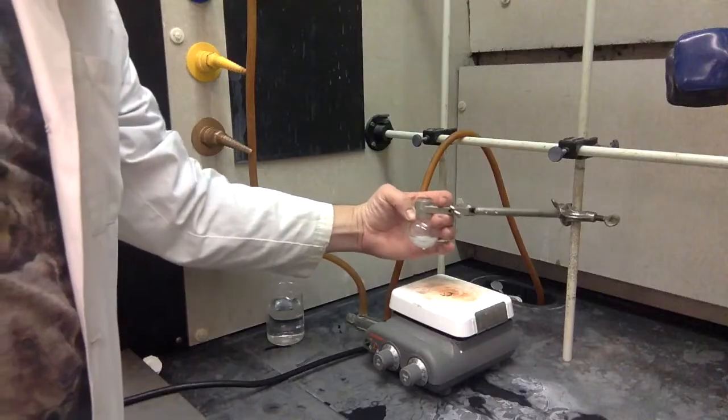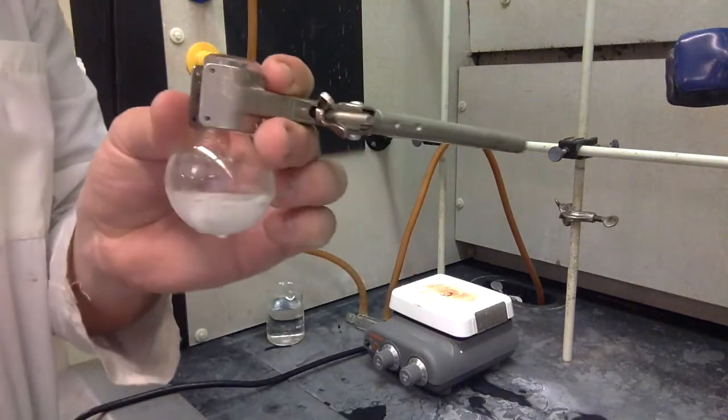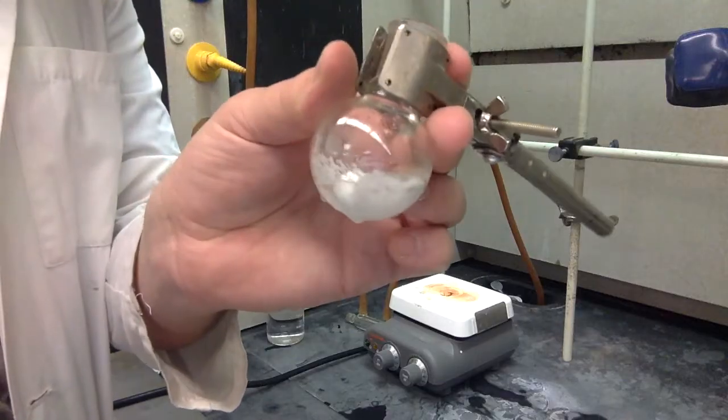Put it into an ice bath just like before, and pour the acid down the reflux condenser in small increments just like before. Eventually, it's going to turn this nice whitish color, sometimes with a tinge of yellow. All three parts of the reaction done, it's time for isolation.